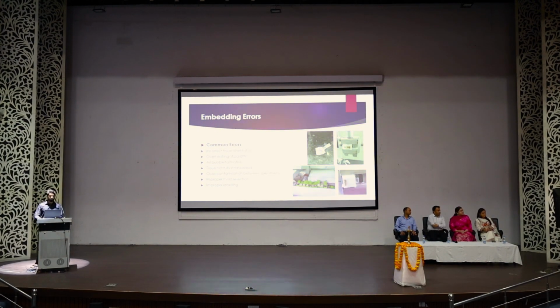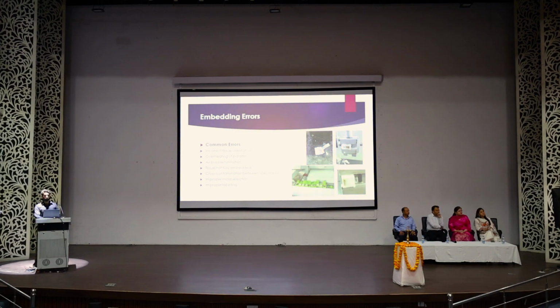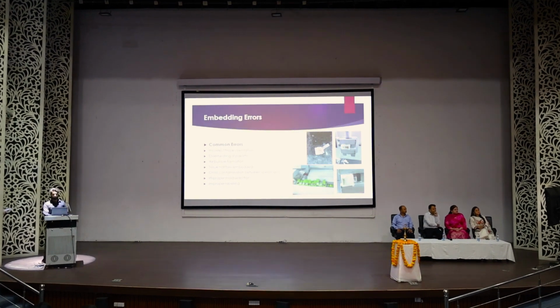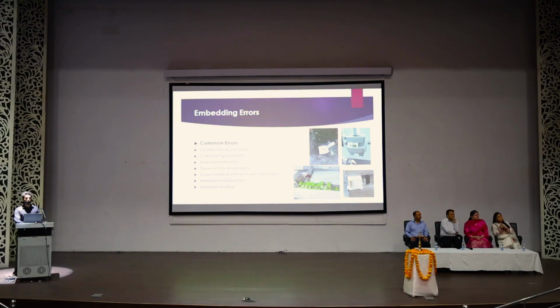The next challenge we face in embedding is cross-contamination between specimens. As you can see in the image, multiple plastic tissue cassettes are open at a time, and these are few blocks. One block that is folded or that is set in block holder. You can see the tissue that has been embedded at one side of the block, and it is not an ideal position of a tissue to be embedded.